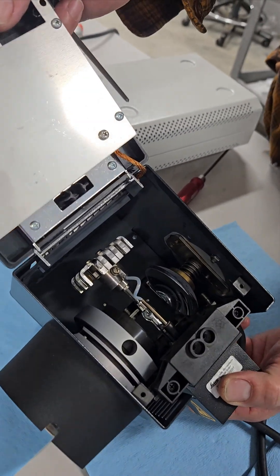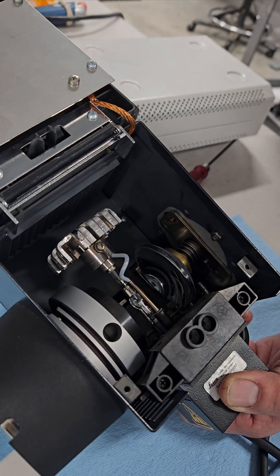And then this little plug will pull straight up and the door will open. There's your mercury light bulb. These two Phillips screws will remove the socket.